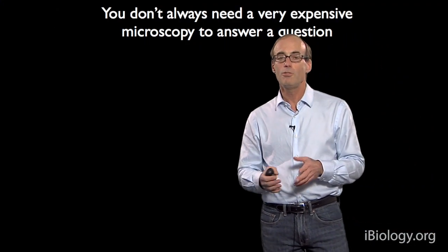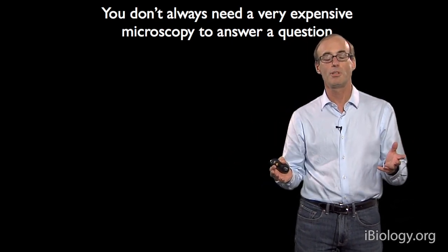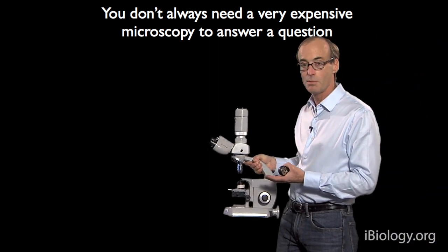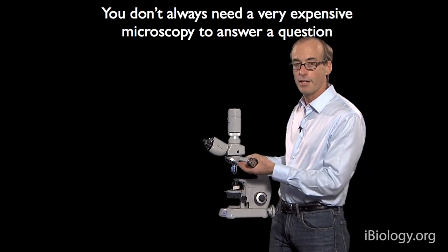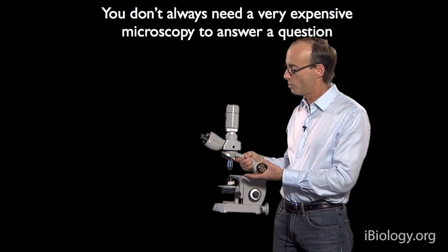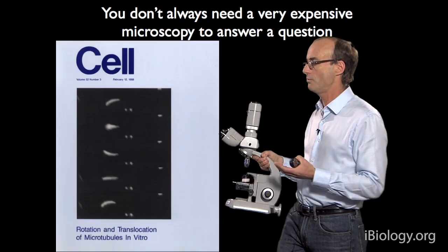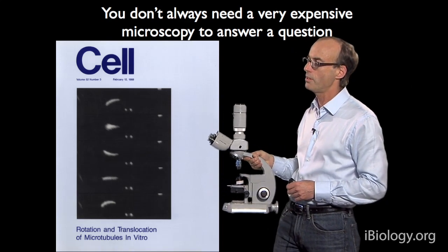I also want to say that you don't always need the most expensive microscope to answer a biological problem. When I started my lab at UCSF, the workhorse of our laboratory was a very simple dark field microscope — just a simple condenser, one objective lens, and a camera on top. It was a simple microscope you could pick up with one hand, and yet it was a very good technique for imaging microtubules and how they were moved by motor proteins. In fact, this particular image on the cover cell was generated with that microscope.